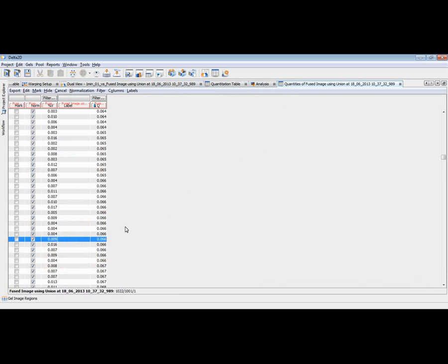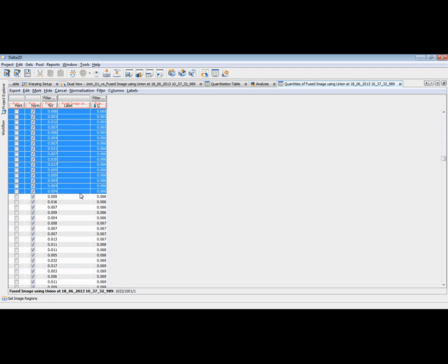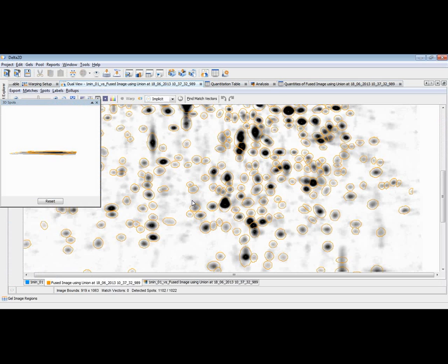I would like to eliminate and get rid of all those with less spot quality. I click one of them and go to the top of the table and shift click the first one to select the whole region of this spot quality to my benchmark, and then I just can say cancel the selected spots. And now a lot of spots have been deleted from my fused image. So this is a quick way to get rid of weak spots, but that's not the whole story.